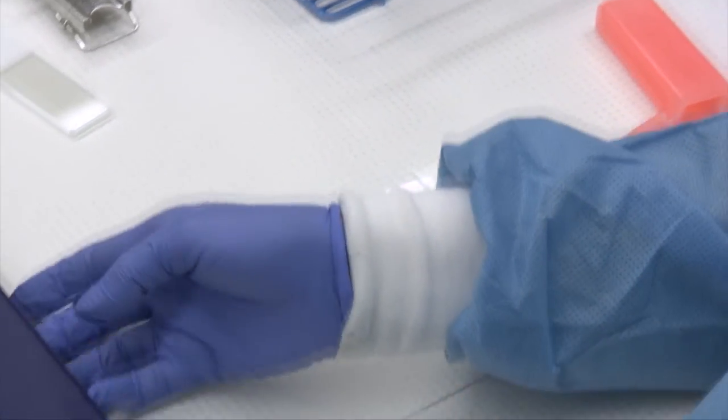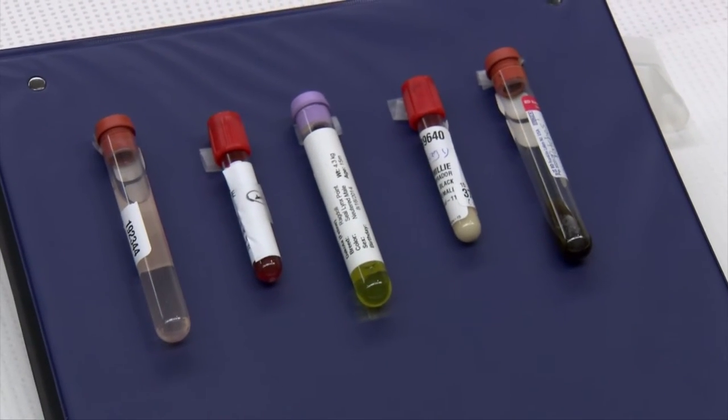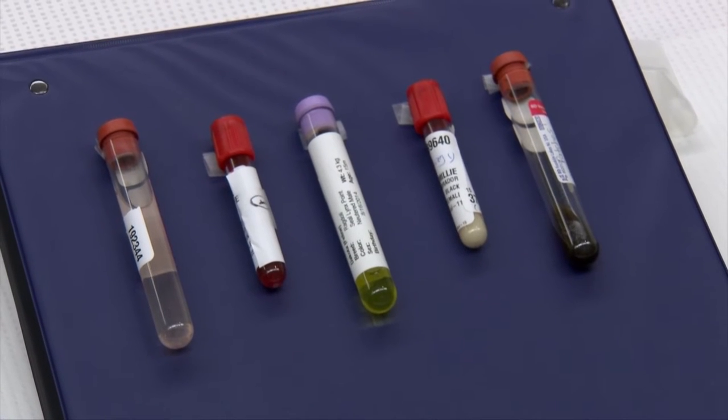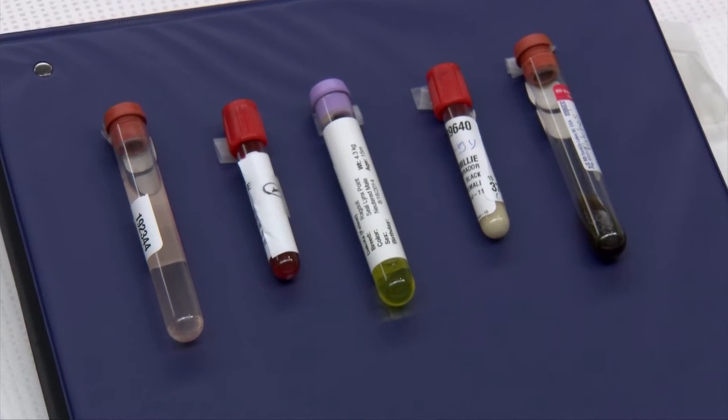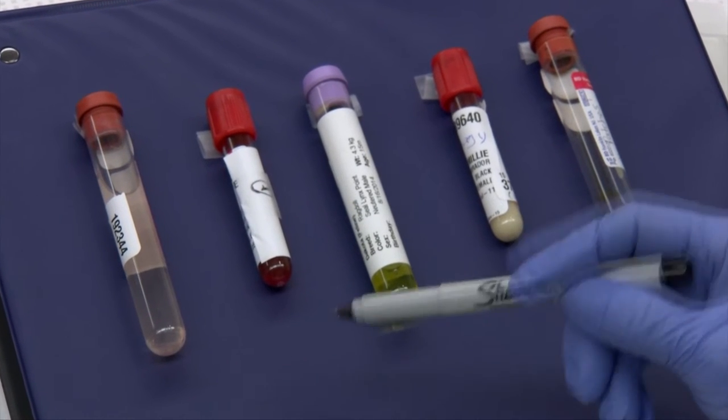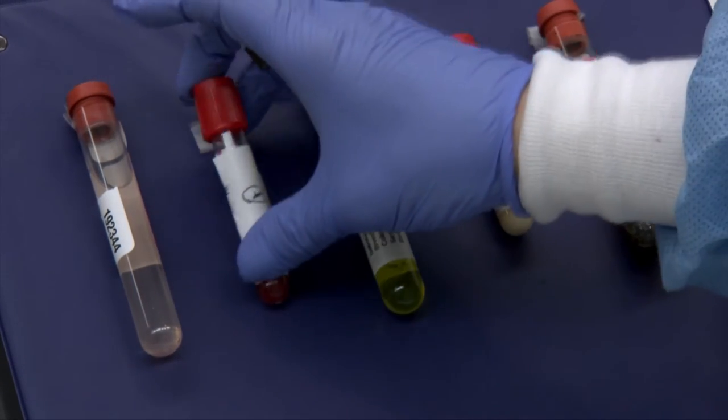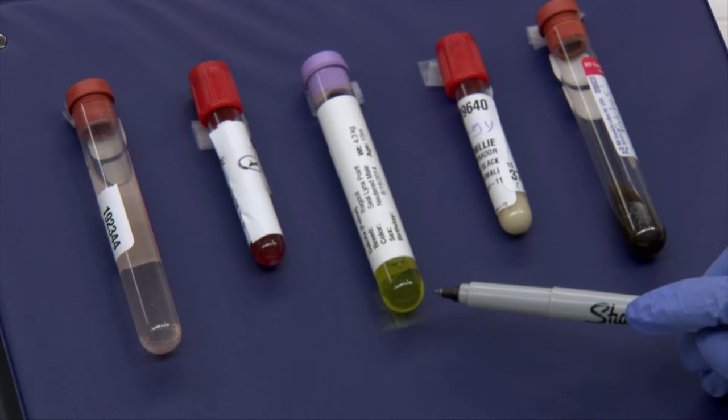Another part of our fluid assessment is that of color and turbidity. Here we have a nice variation as to what we often see. It's kind of pretty open as to how you describe it. But this would be slightly red, slightly cloudy. This moderately red, moderately cloudy. This would be bright yellow and clear.